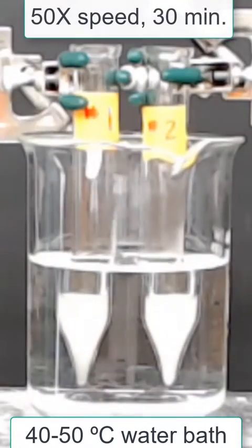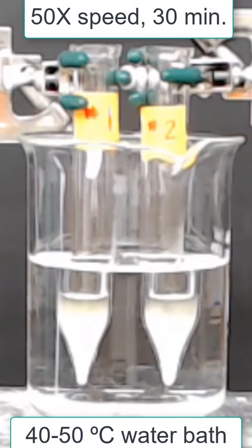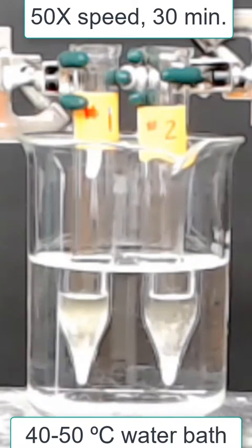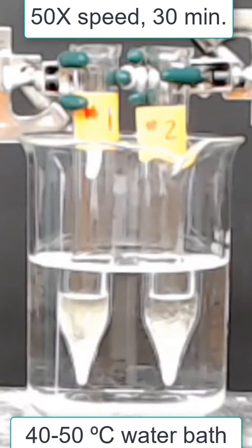As the reaction proceeds, sodium chloride and sodium bromide products are produced. These are insoluble salts in acetone, so we can see the precipitate developing. That's a good sign because it means the reactions are working.